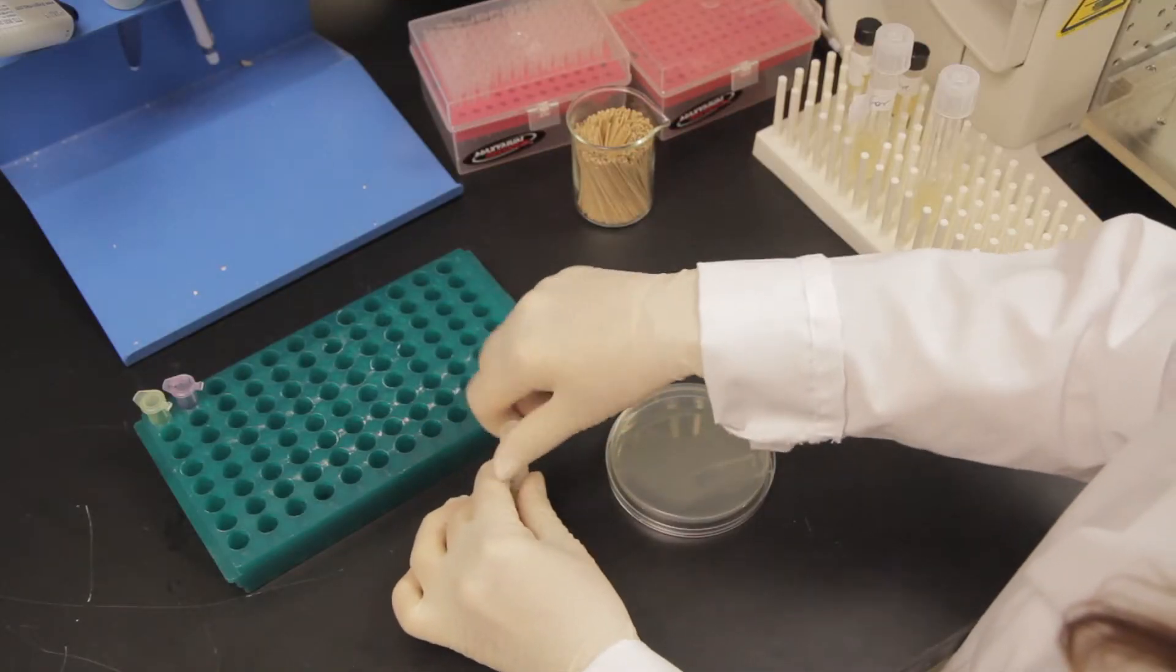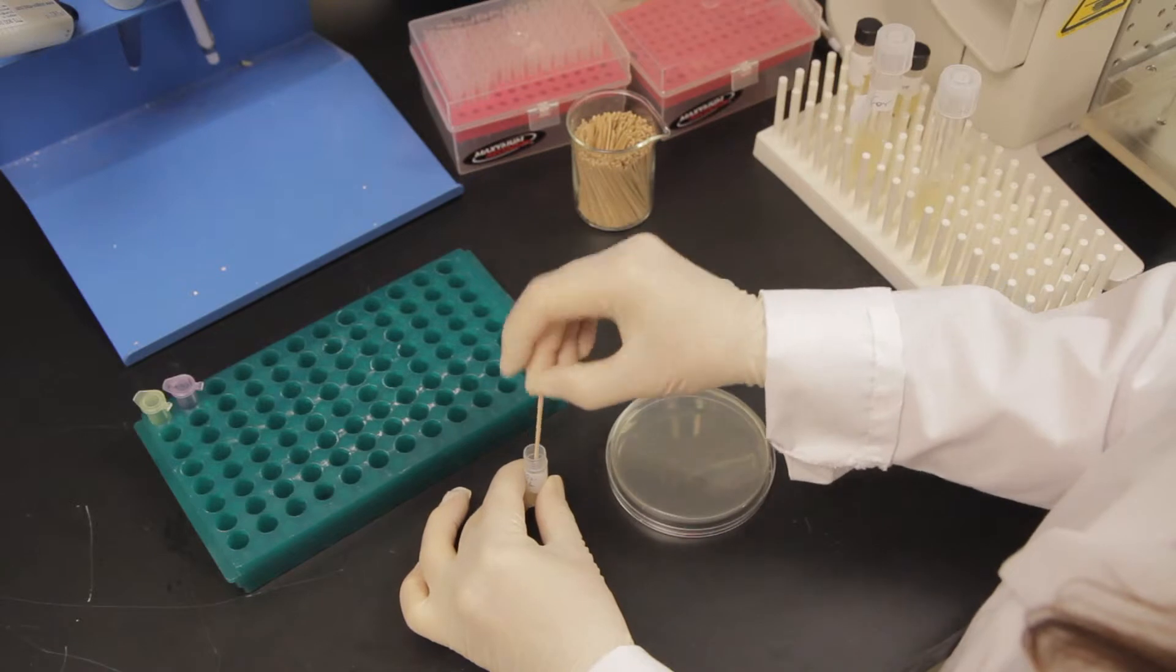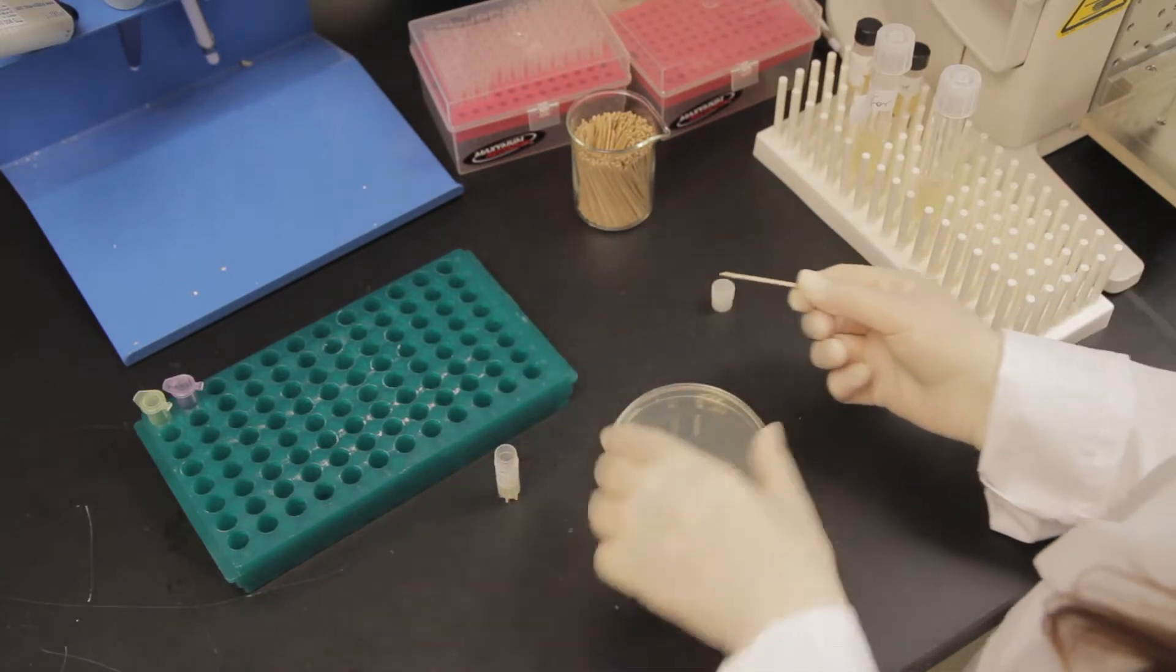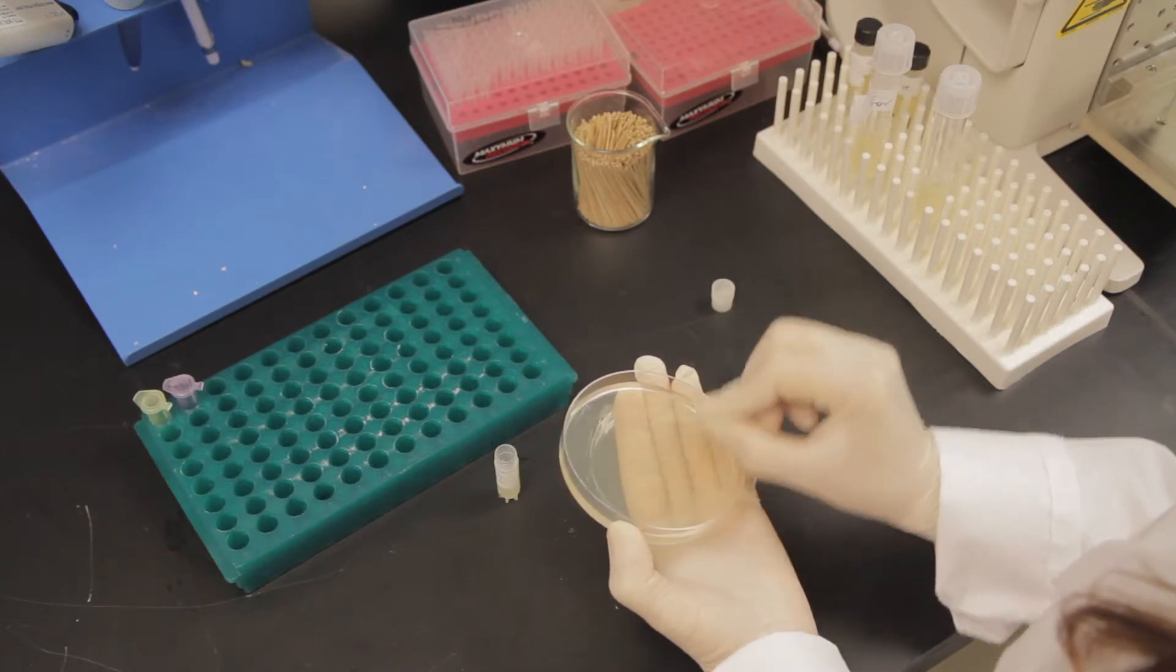If you are returning bacteria, please send plates with single colonies. To do this, use a sterile toothpick, gently dip into your glycerol stock, and streak your toothpick across the agar several times.